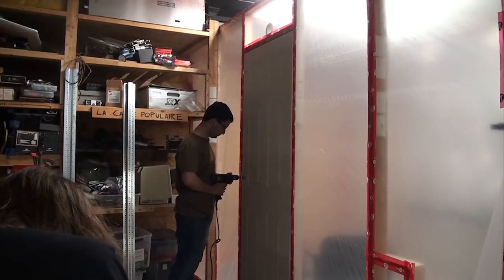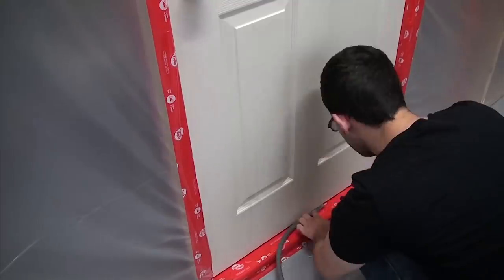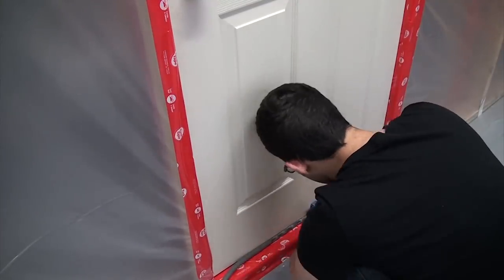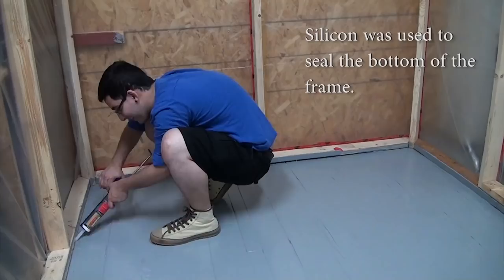With that done, the door could be hung, a doorknob hole was drilled out, and the doorknob and bracket set into place. To prevent air getting in around the door, some weather stripping was added snugly to the door frame so that when the door closes, it will seal nicely.